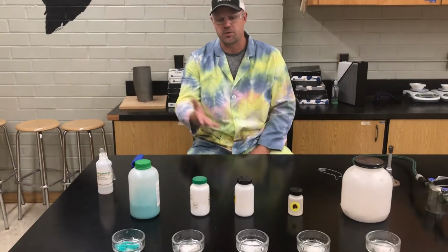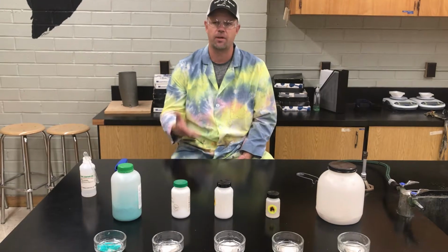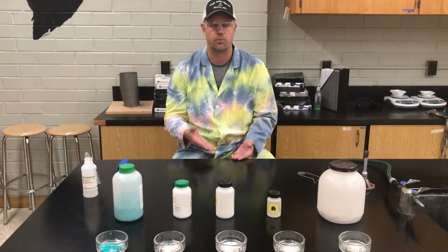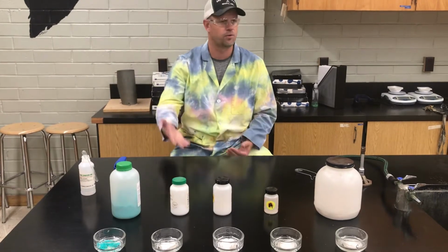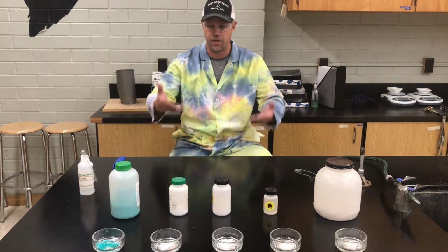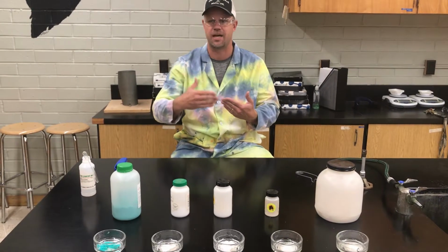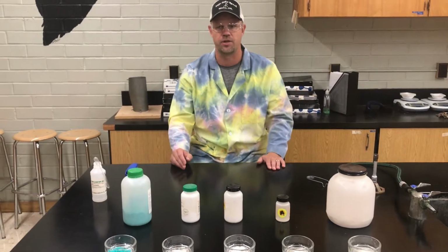Now, what I'm going to do is I'm going to heat these up, and I'm not trying to get them to react with any oxygen. I just want to give them enough energy to get those electrons bouncing around. And when they bounce from a particular level they started at to a new level, remember they release a photon of light. Okay? And that light will come off with a particular amount of energy, and you can sometimes detect different amounts of energy just based on the color of the light. This is kind of a chemical signature for each of these elements.